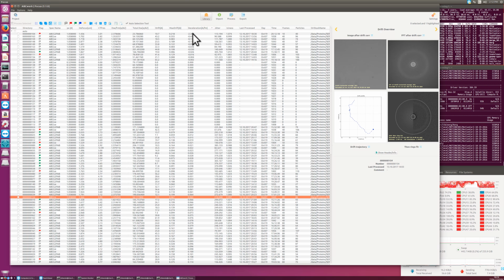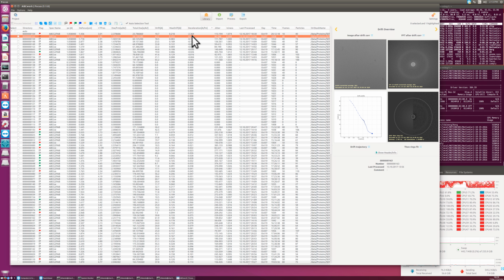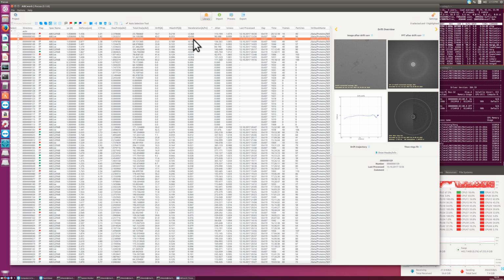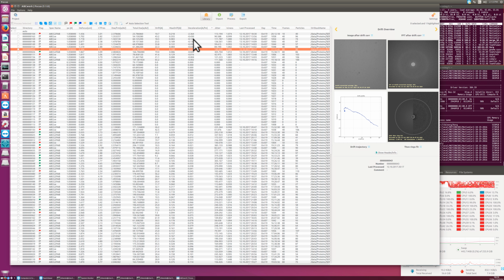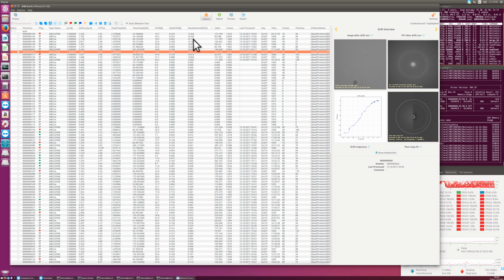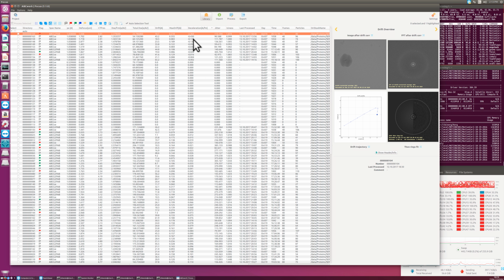Deceleration should usually be a positive value. If the deceleration is negative, that means the drift started slow and then got faster and faster, probably because the ice film ruptured. In such cases, the image may not be too useful, but these might still look reasonable. Maybe just the first one here, this is odd, this has only 10 frames, so I would also flag this as something that we don't want.